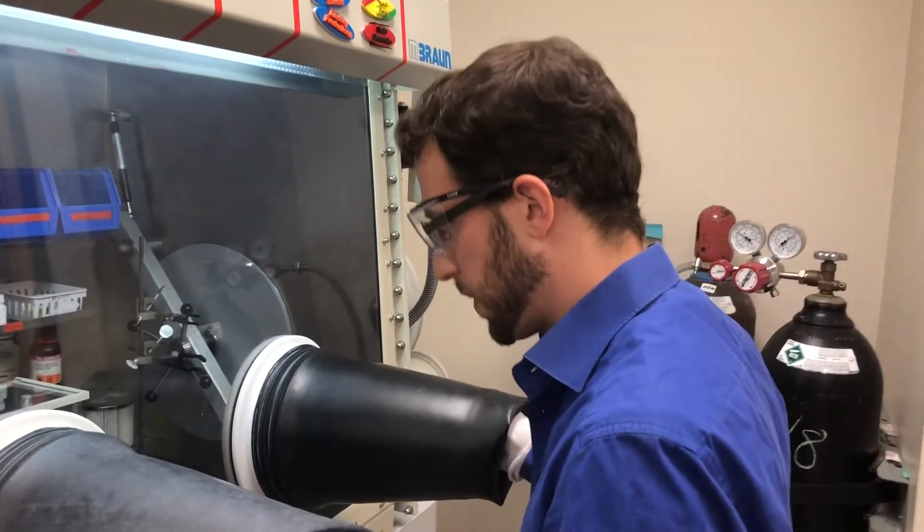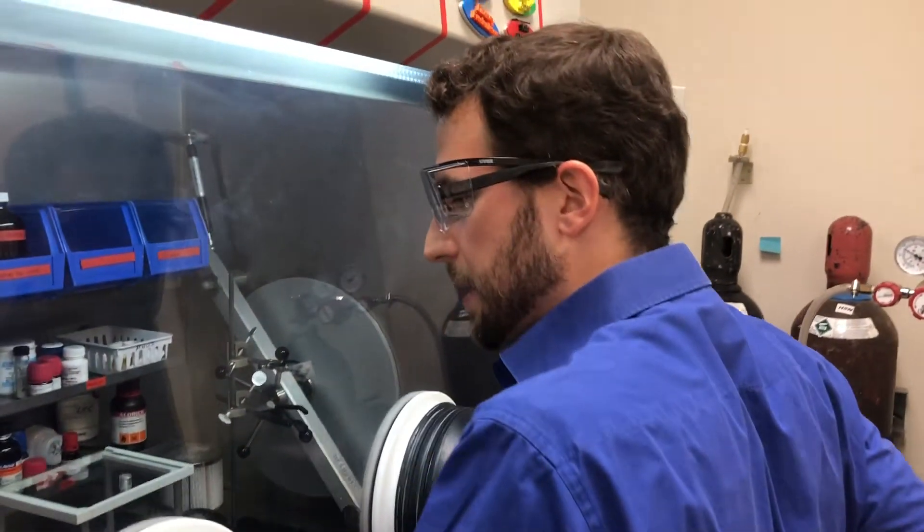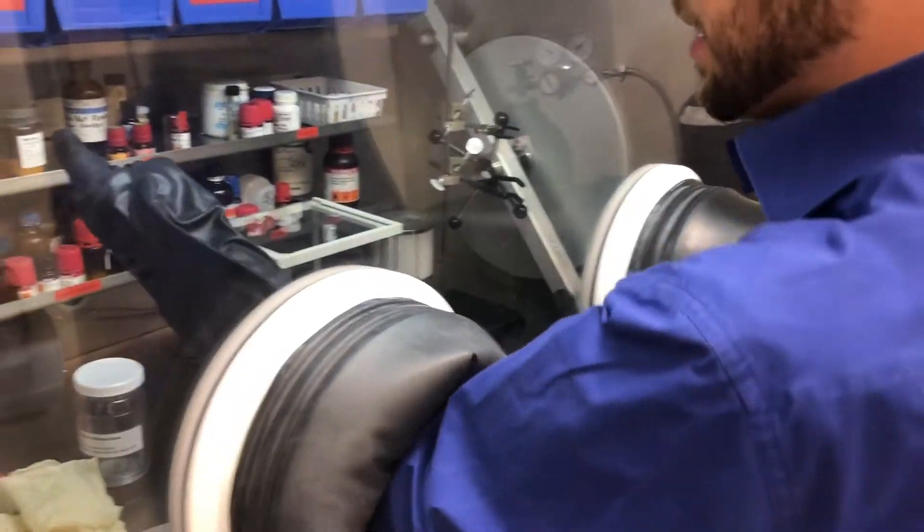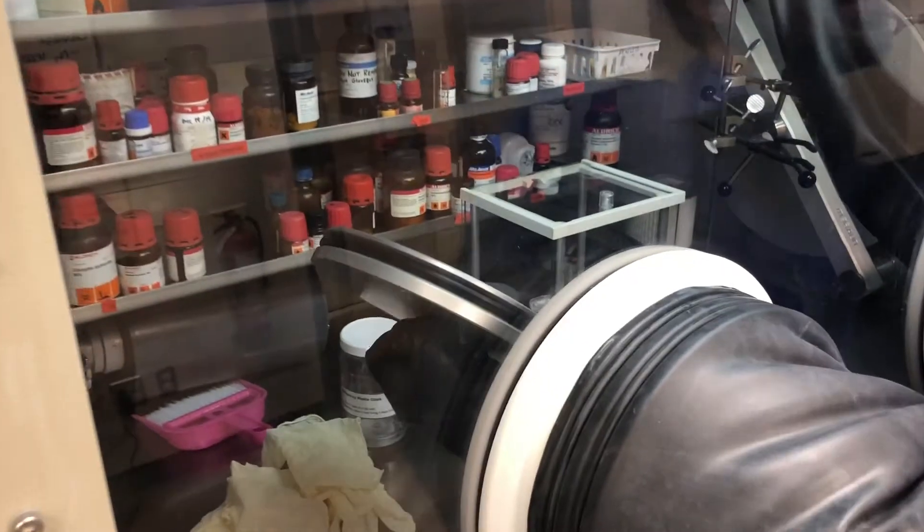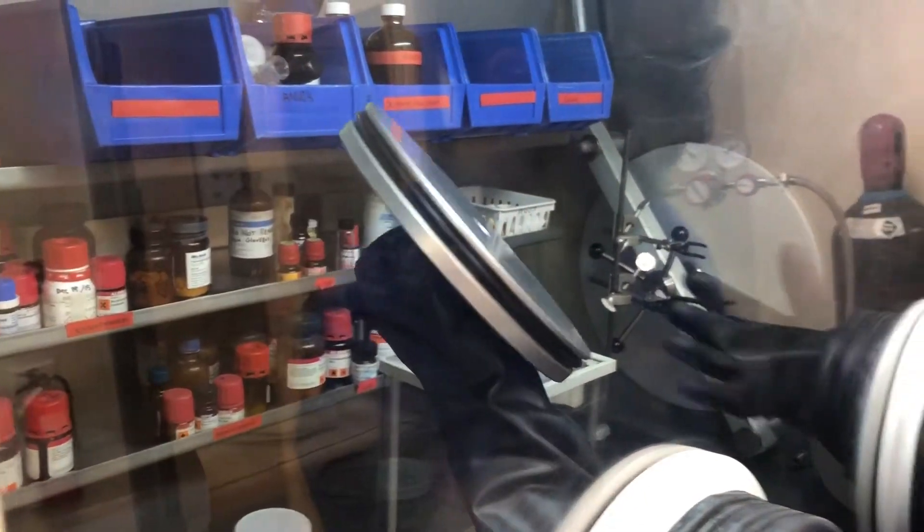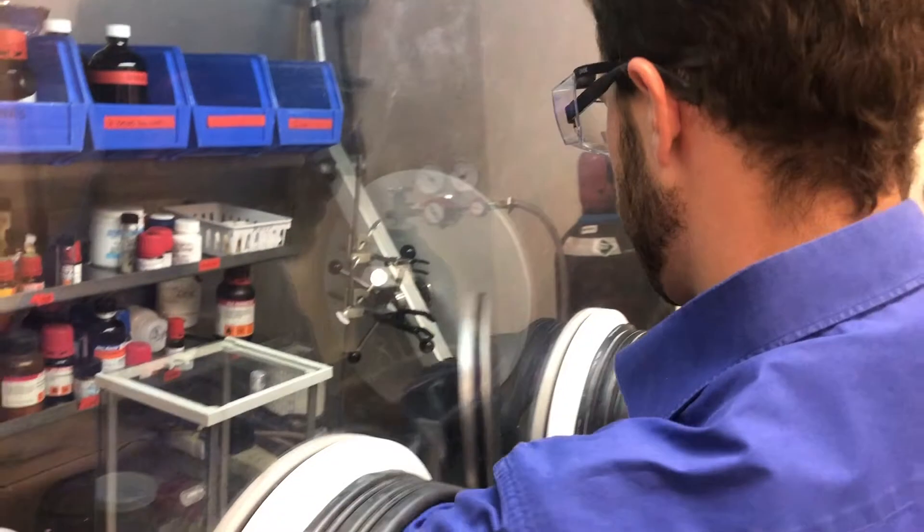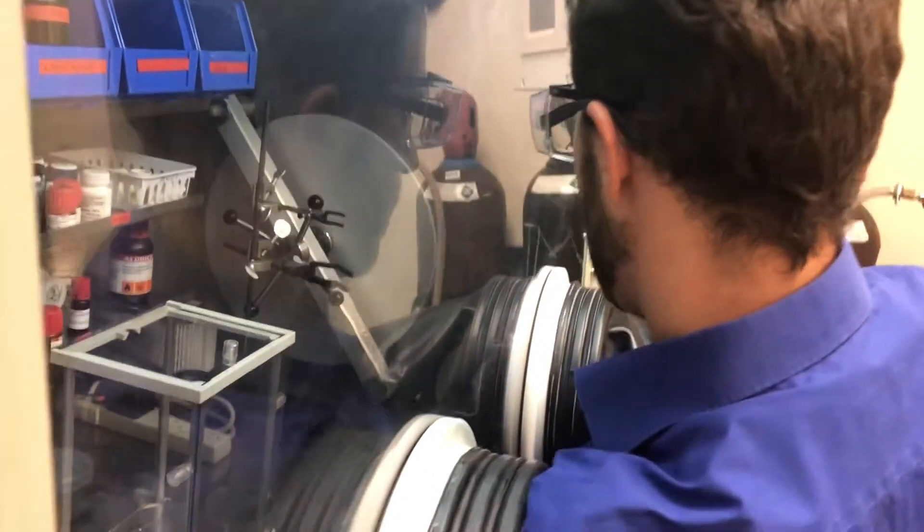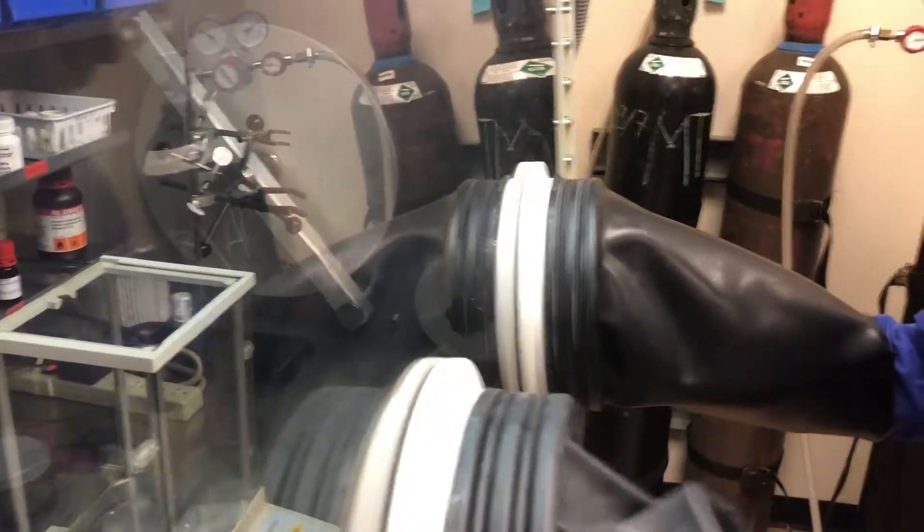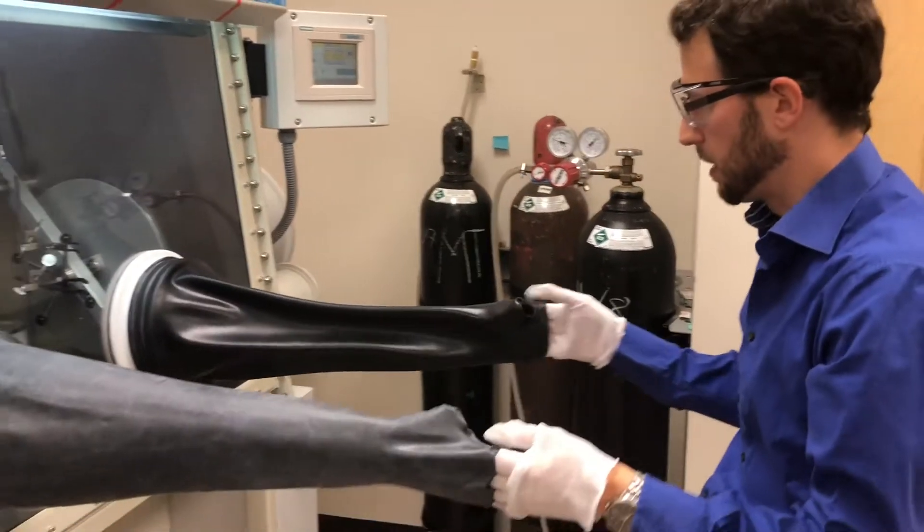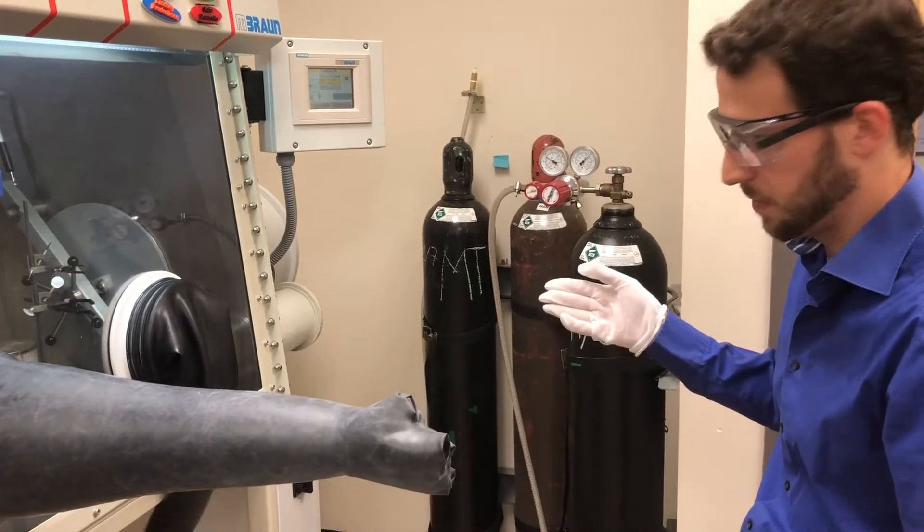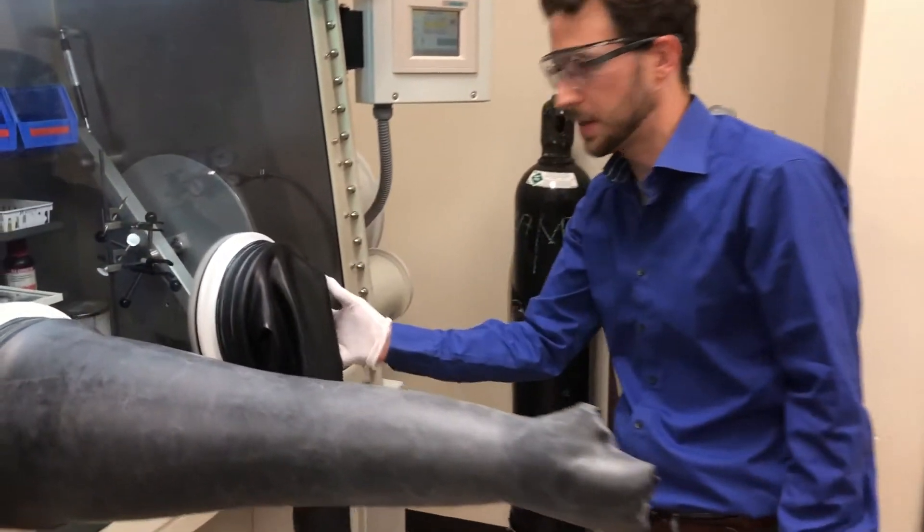So you just go in the glove box and you will find there's this additional door that we keep in here and you want to use this to block off this side just by turning the knob. Get really tight. When you go out you will see that the glove that you cut off it will not refill anymore. That's a good sign.